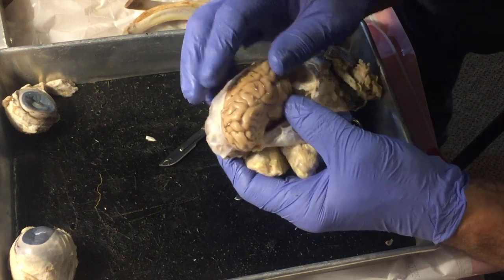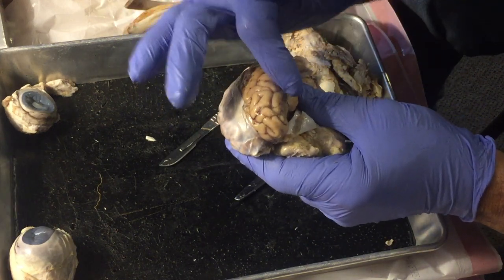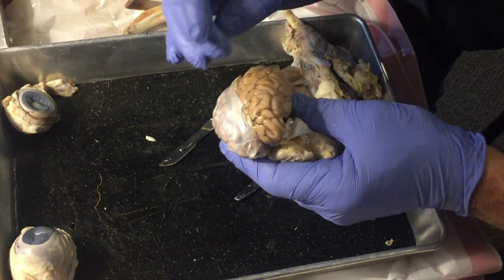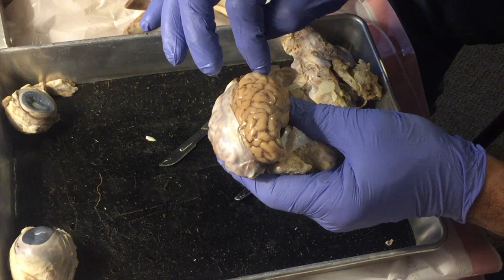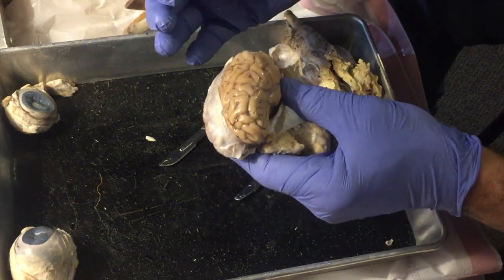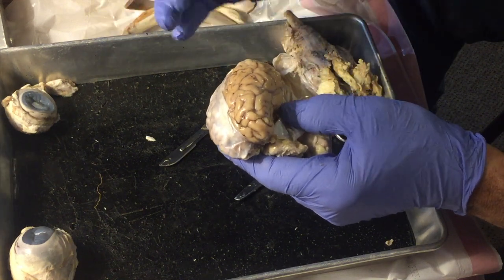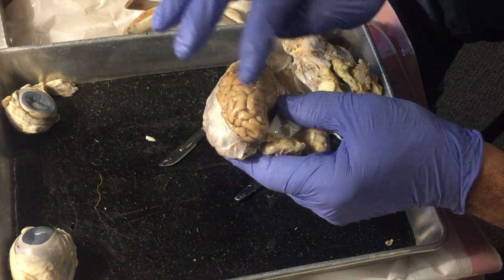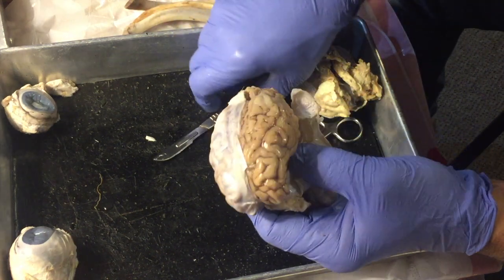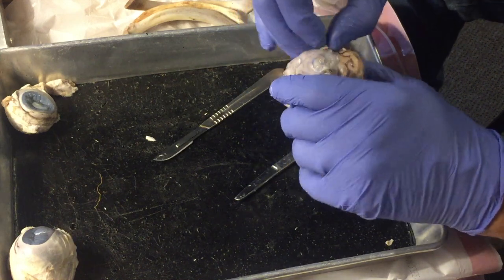And on the brain, we would have what's called the temporal lobe, the parietal lobe, occipital lobe, frontal lobe. It looks like just a bunch of chewed bubble gum, but there are ridges and valleys called gyri and sulci here, and they're in specific places. There's not a randomness here. And so brains are mapped according to where those ridges and valleys are in them.